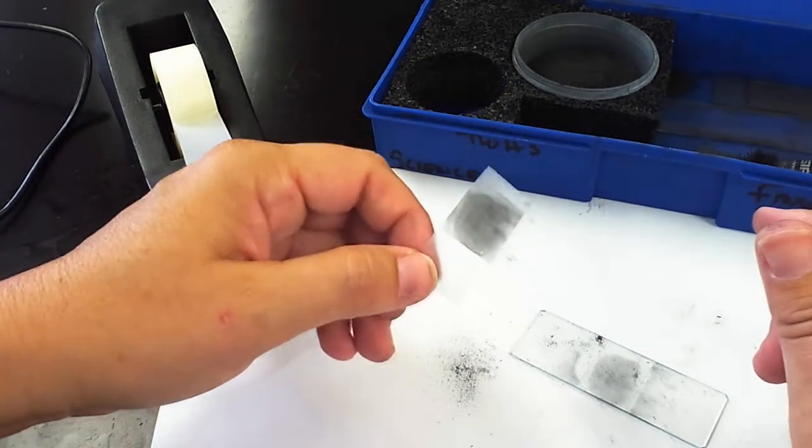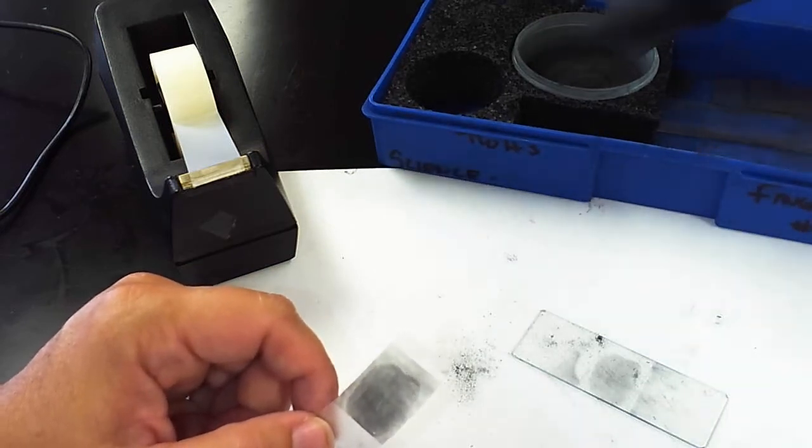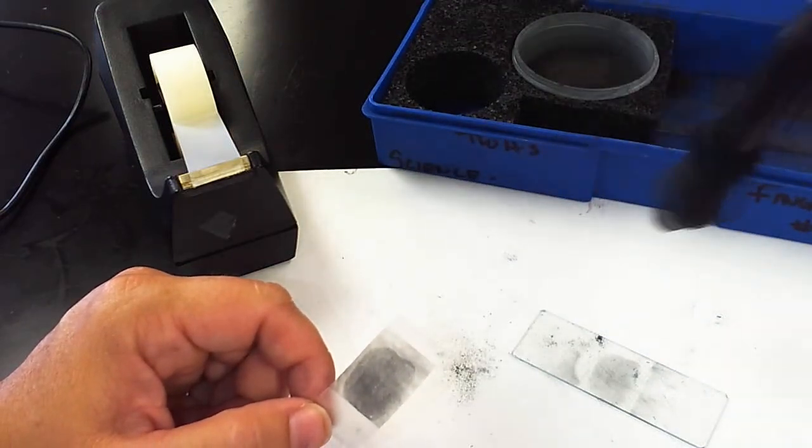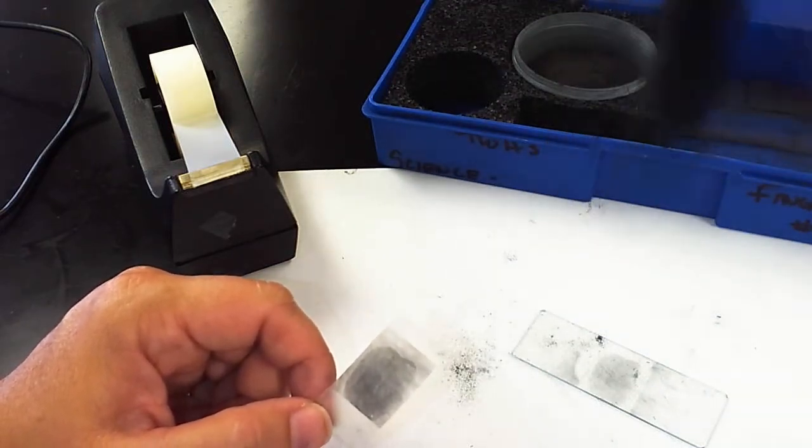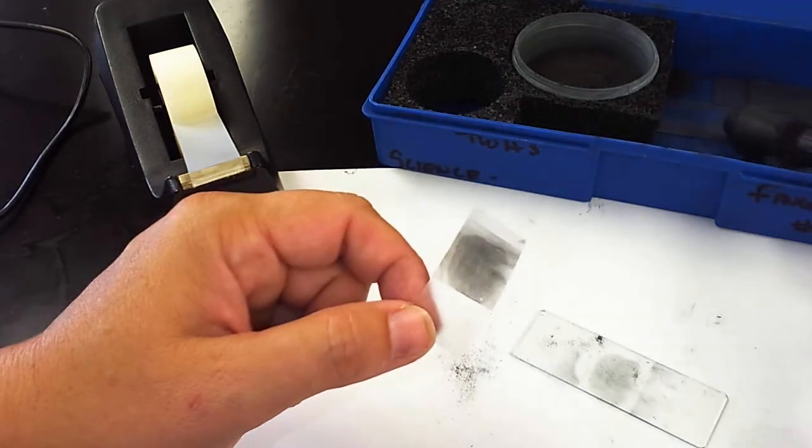Again, I'm really looking for you to do this maybe three or four times to practice. You can practice with the wand, painting very lightly, swirling it, dabbing it. Try some different techniques even with putting the tape on there.